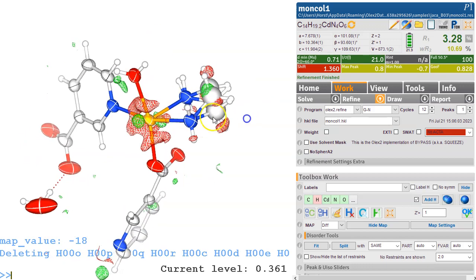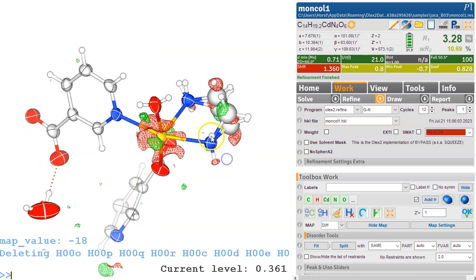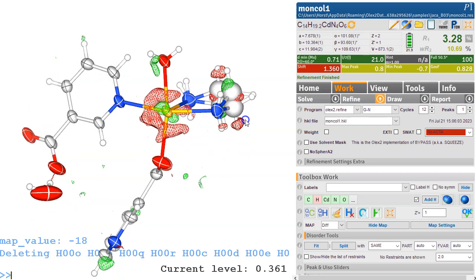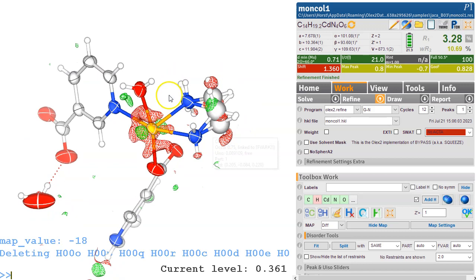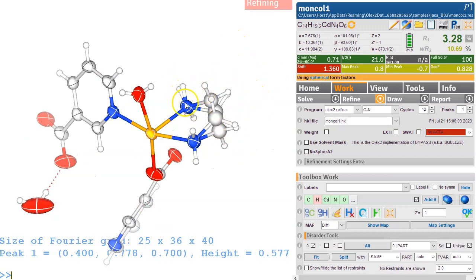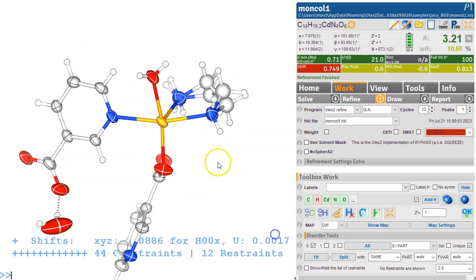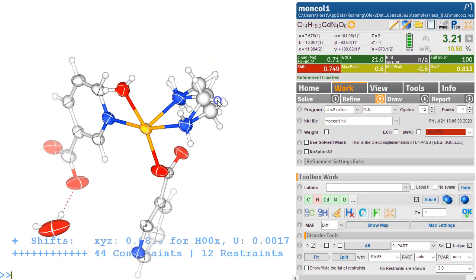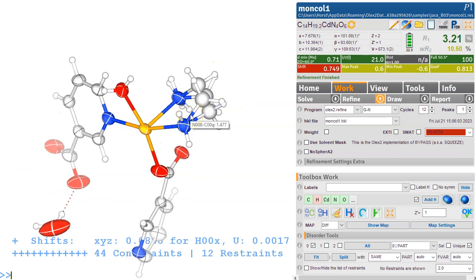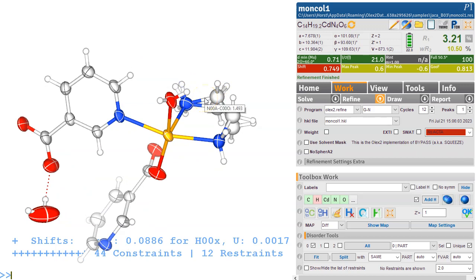We might as well add some hydrogens at that point here, HAdd, and we have done that. And Control, it's only one. It only added one hydrogen to this nitrogen. I'm not quite sure why that is, because really there should be two, one that belongs to this and one that belongs to that. What happens if I do HAdd here? Nothing. So I suspect the distances here aren't quite right. 1477, 1479. So they are very much the same.